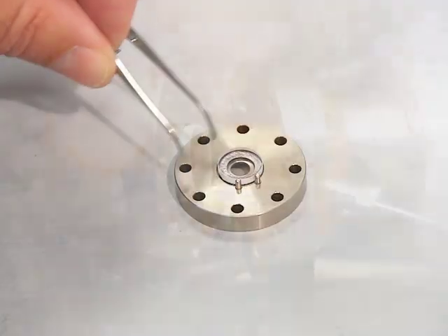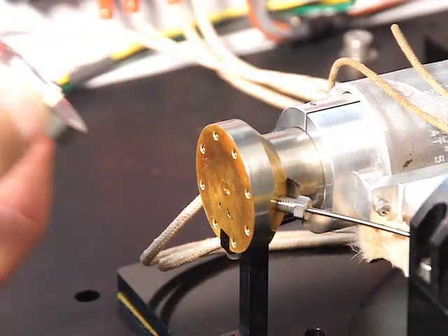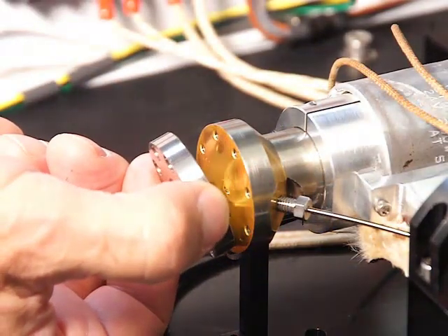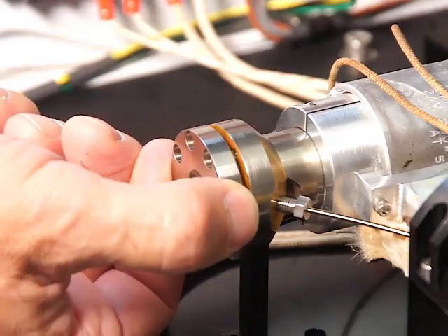Turn and lift the end cap in such a way that the window rests on two pins of the assembly. Position the end cap against the light pipe and carefully guide the pins into the corresponding holes.